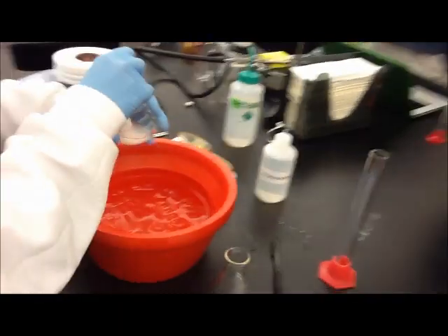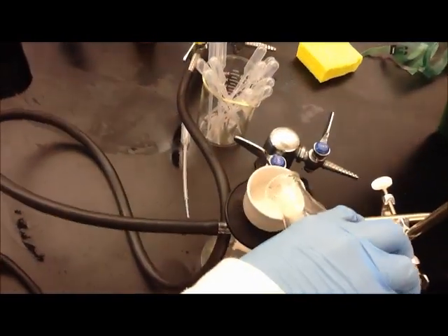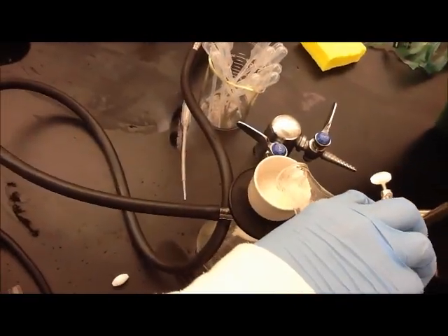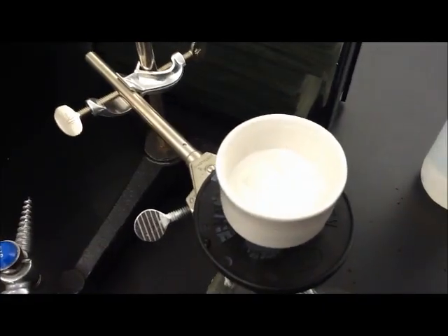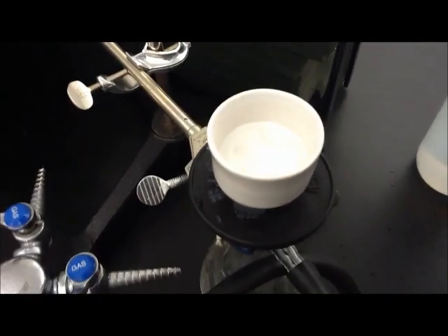And now we ice it. This is the final product. Yeah, it's finished.